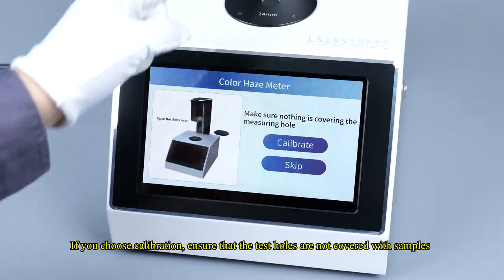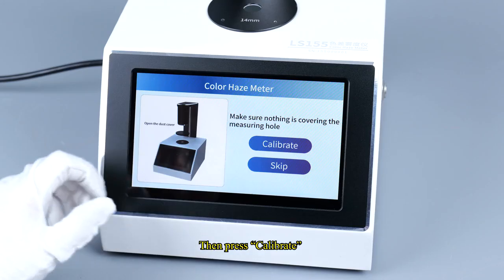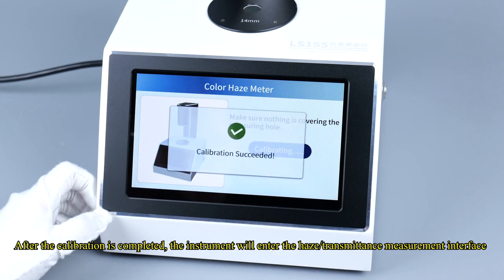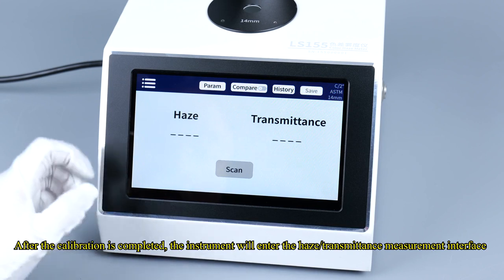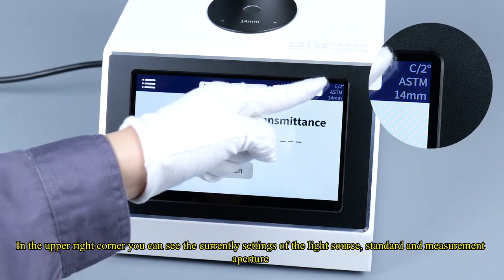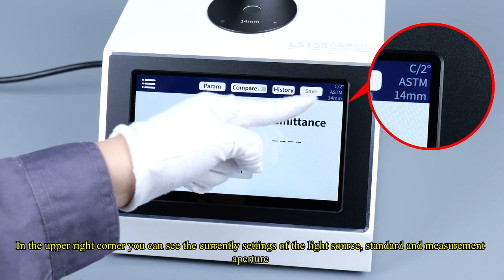If you choose calibration, ensure that the test holes are not covered with samples. Then press Calibrate. After the calibration is completed, the instrument will enter the haze/transmittance measurement interface. In the upper right corner, you can see the current settings of the light source, standard, and measurement aperture.